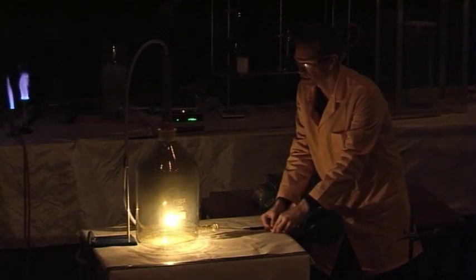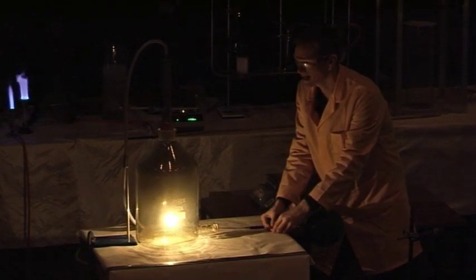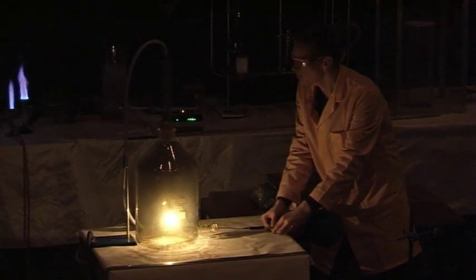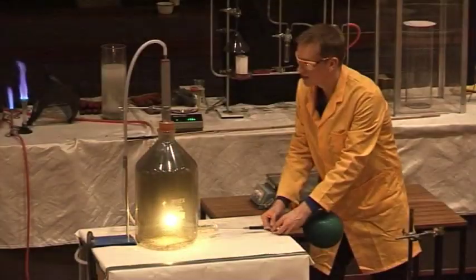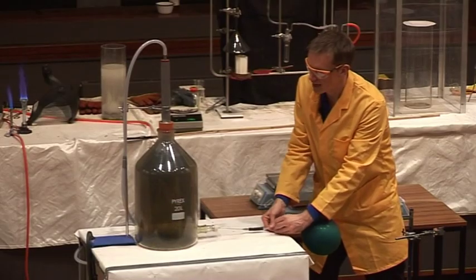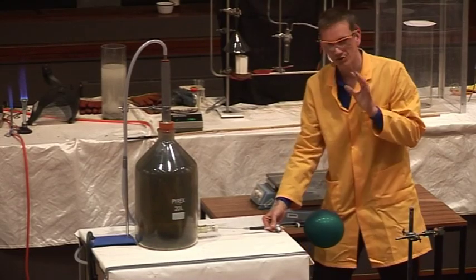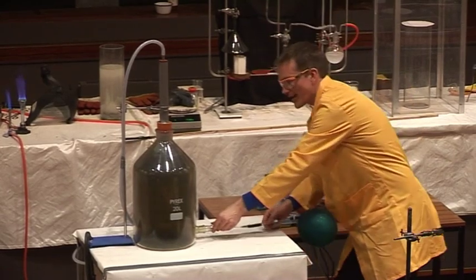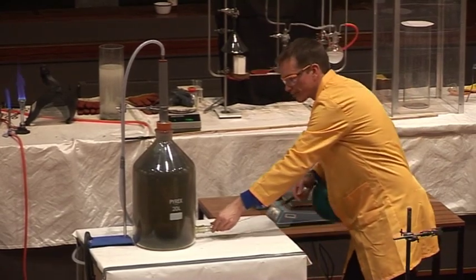This reaction is just chlorine and acetylene. You can see all the carbon that's forming here because the reaction isn't really complete. So it's a very smoky reaction. But nonetheless, this is a reaction involving no oxygen at all.